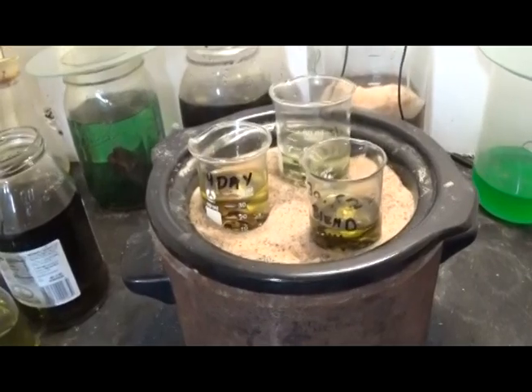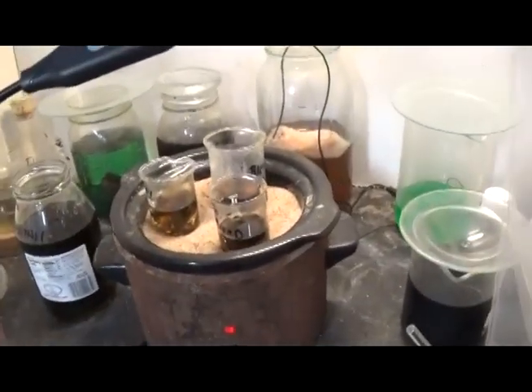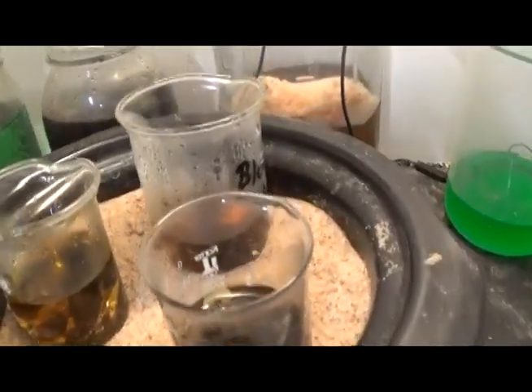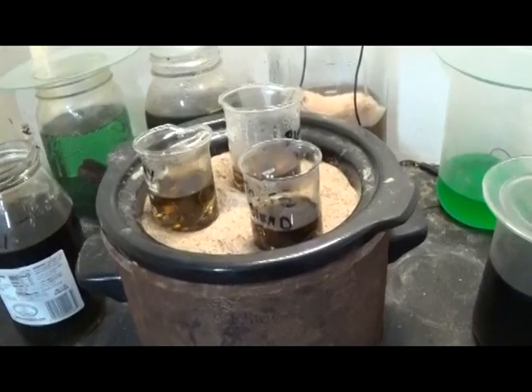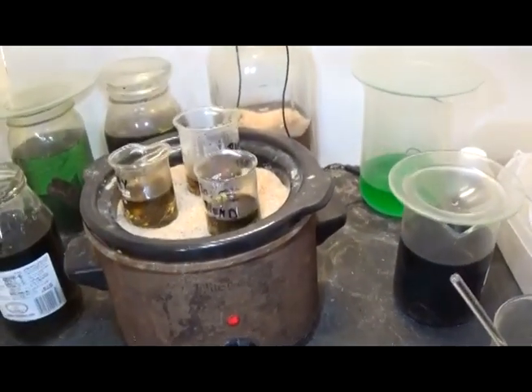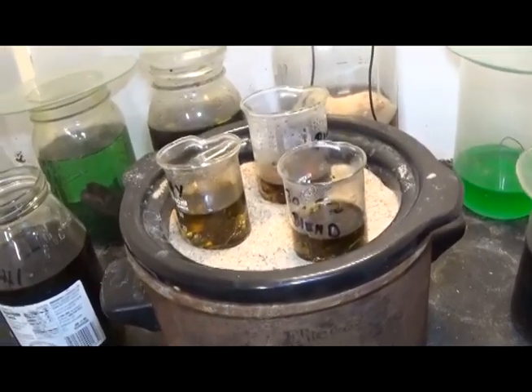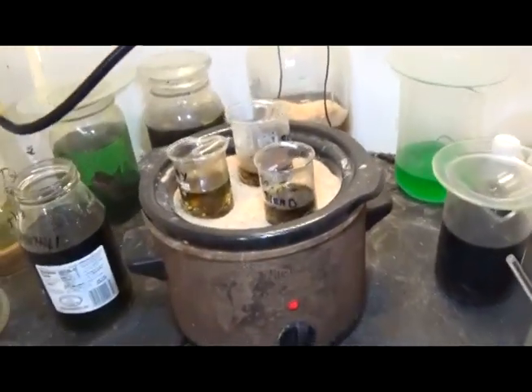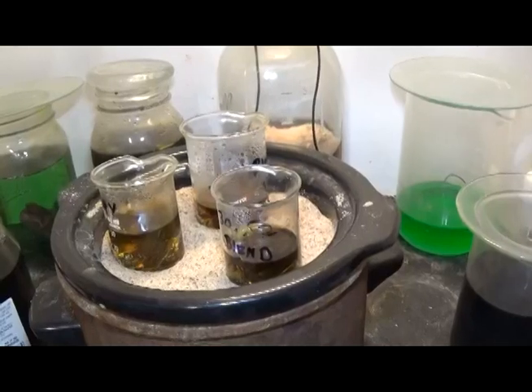It's now a matter of just sitting and performing the experiment as I've got it written up. Let's see what the results are — very curious. We've had everything on for about 14 hours and so far, so good. Seeing very minor gold foil separation in this sample, and the rest not so much. We're going to let that stuff cook, continue to add the ingredients as I see fit. We're only a half a day into a three-day experiment to see which copper chloride solution we're going to put in this bottle.